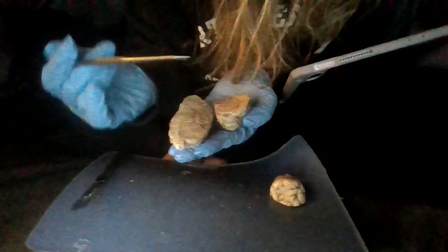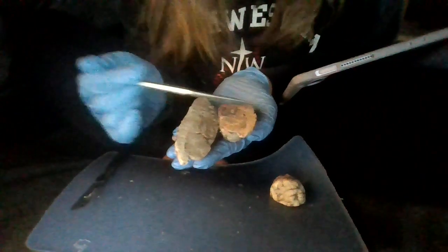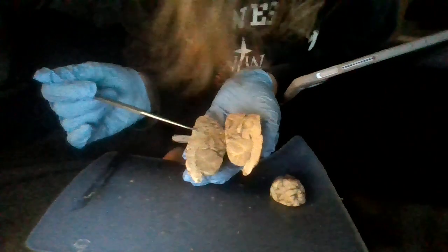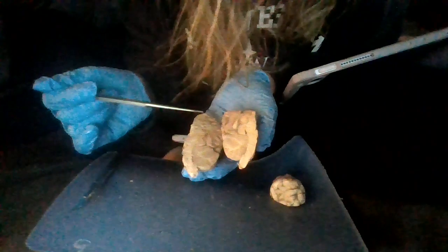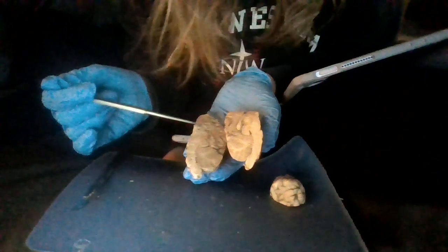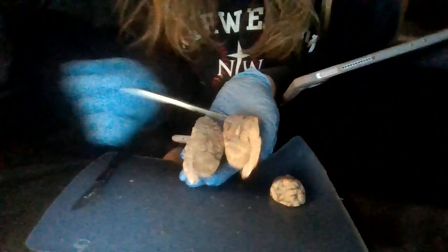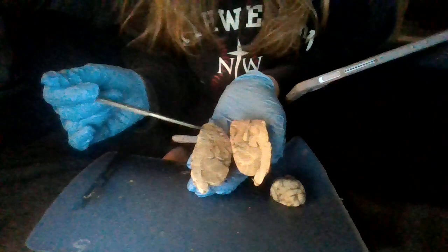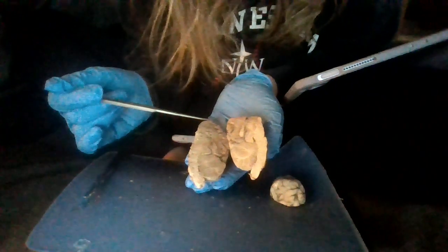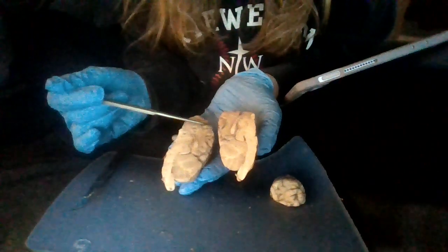And then we have our hypothalamus, which is going to be this lower portion of the top part of the brain, which might be this piece right here. And then we have our optic nerve, which is going to be a frontal piece towards the front of our brain. It would be higher up than what's already cut off here, but it's more frontal. And then we're going to have our olfactory bulb, which is going to be right in here.